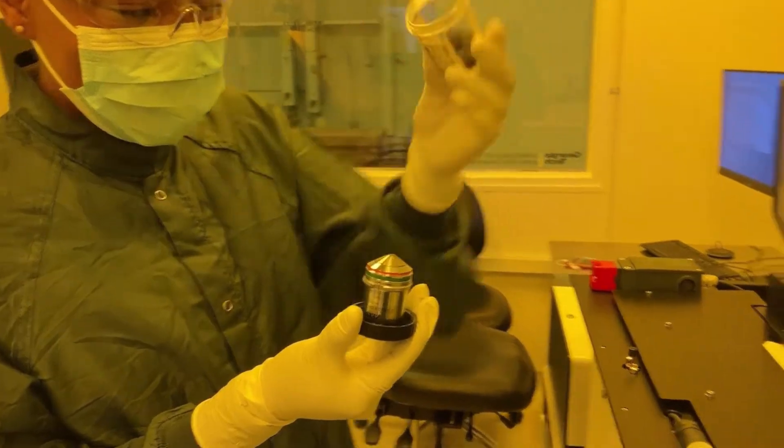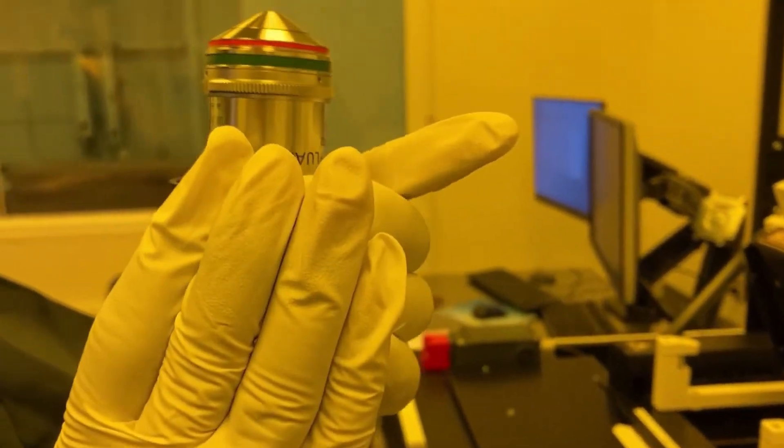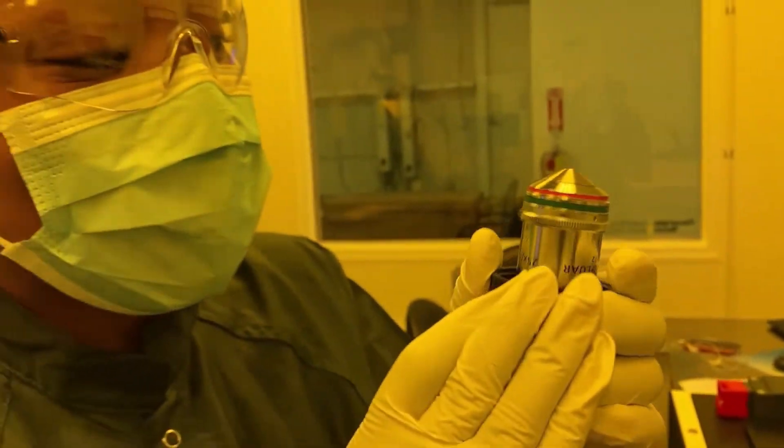We have three lenses: the 63x for smaller prints, the 10x for larger prints, and the 25x for medium prints, which we will be using today.